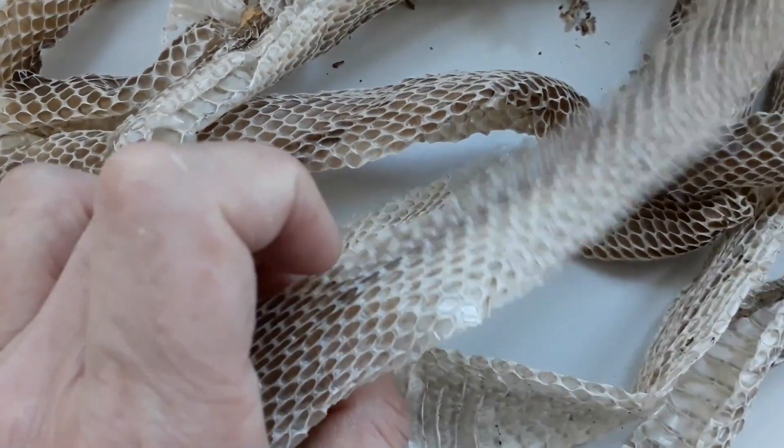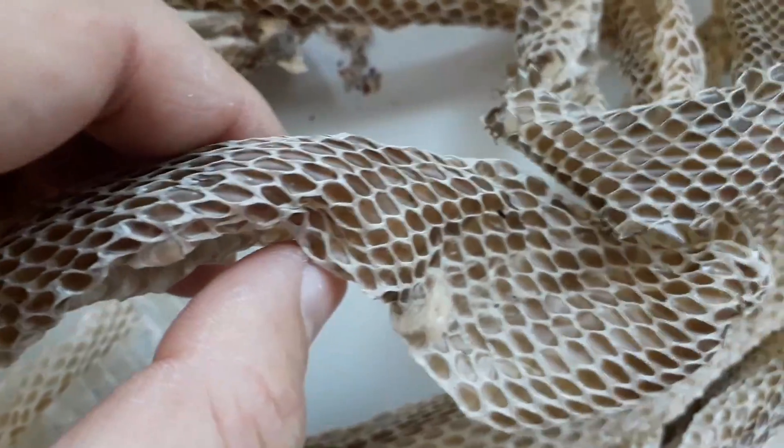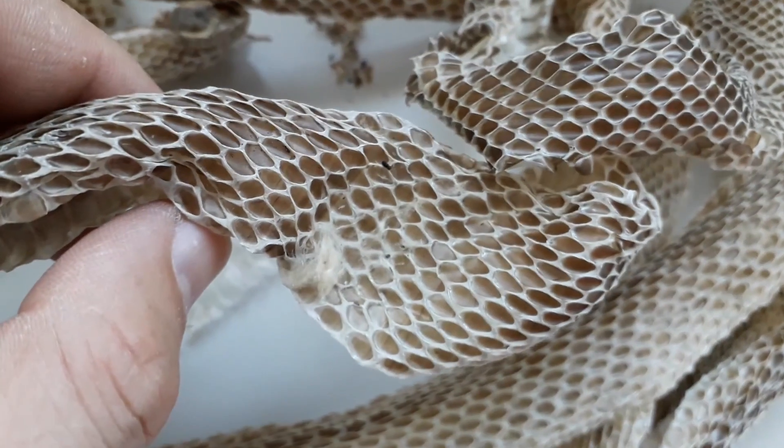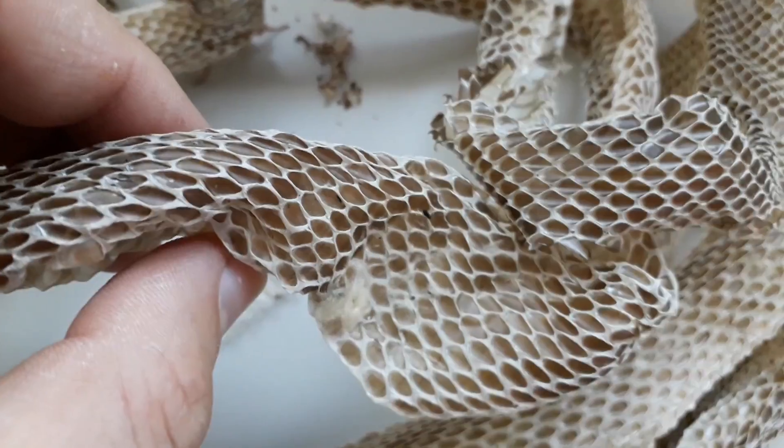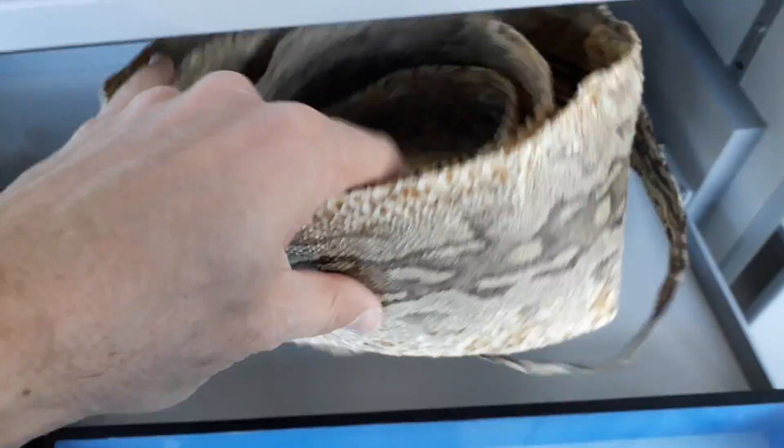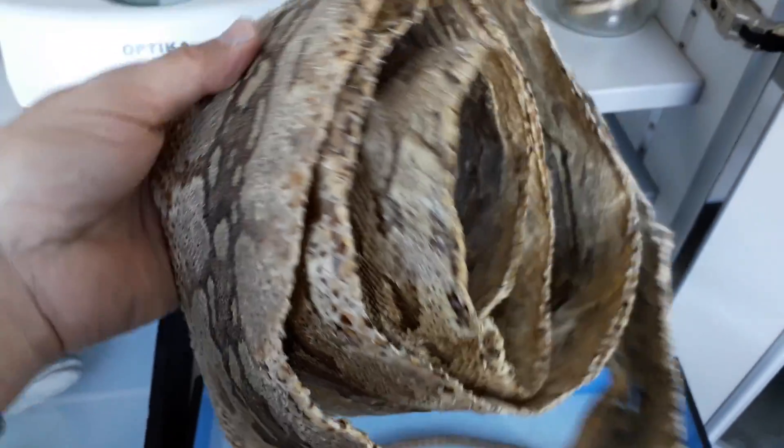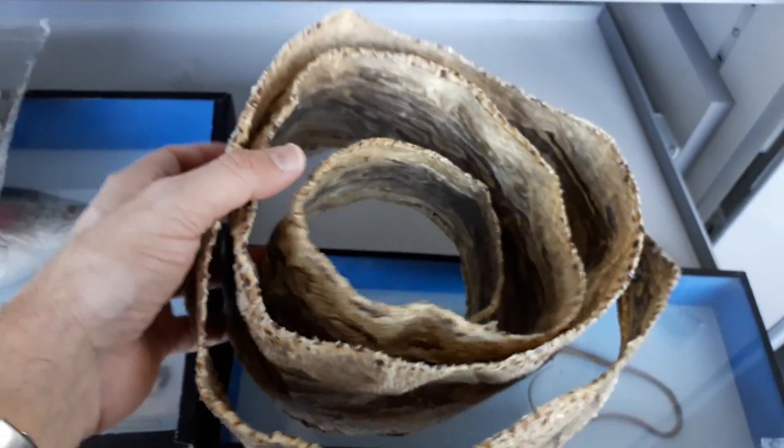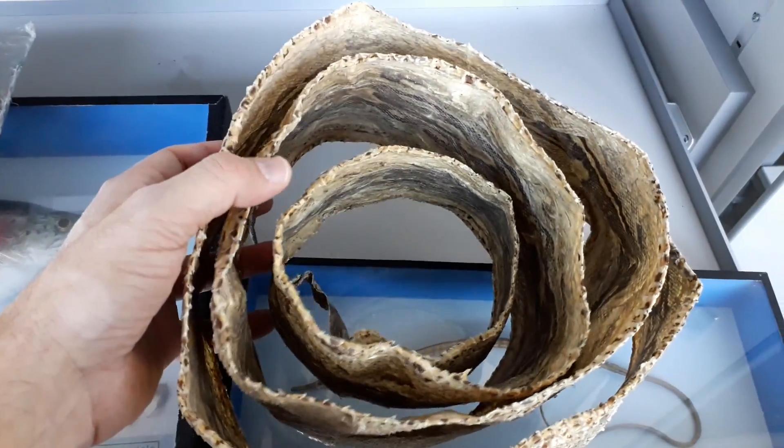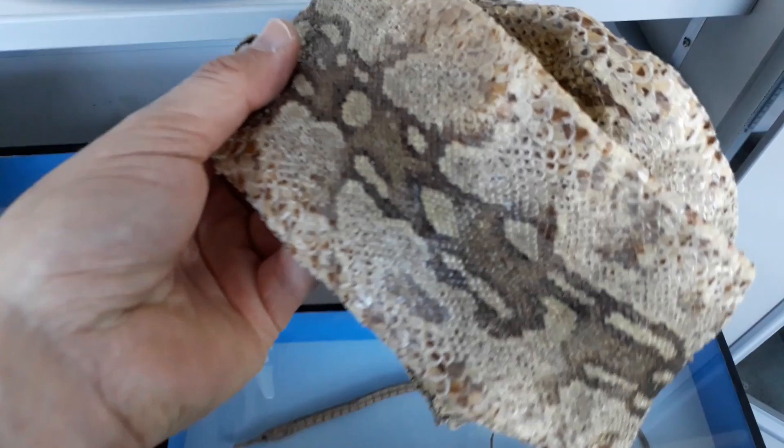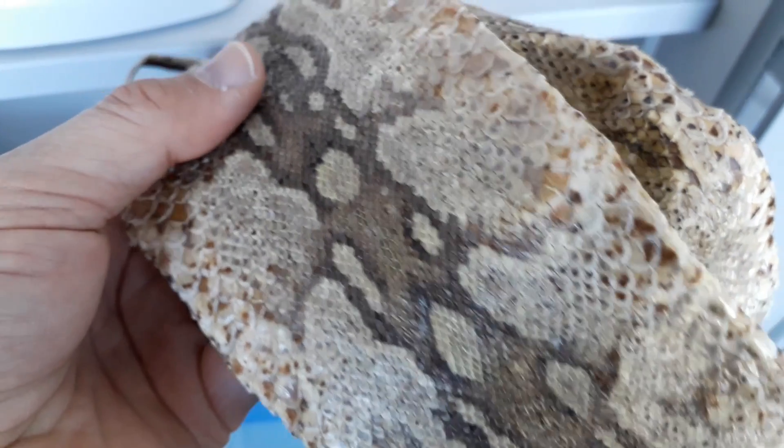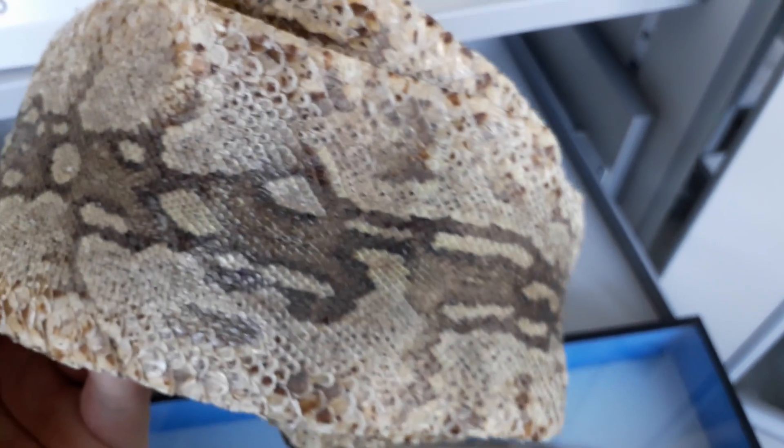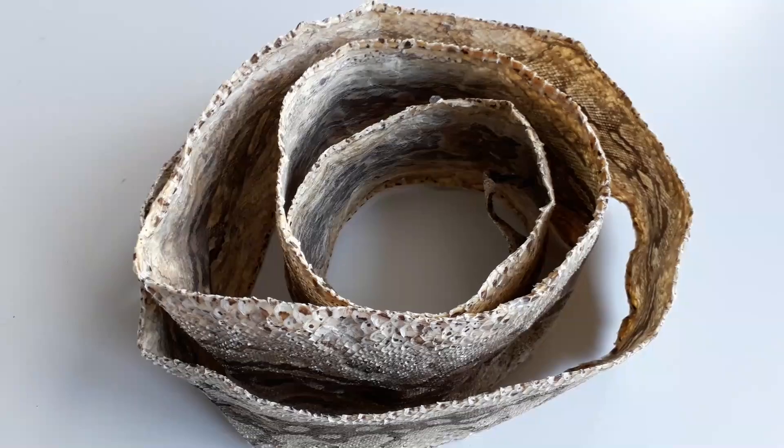They brought it along. It's pretty fragile and feels like paper, but it will make an interesting specimen. We also have professionally prepared snake leather in our collection. It's dry and fragile but not very flexible, so I have to be careful bending it straight without breaking it.